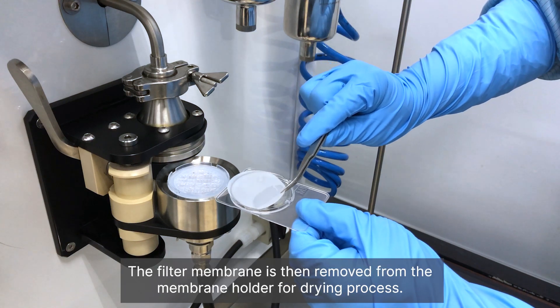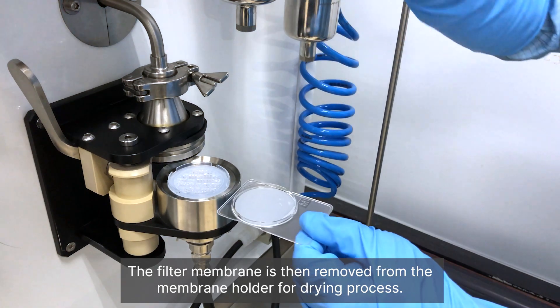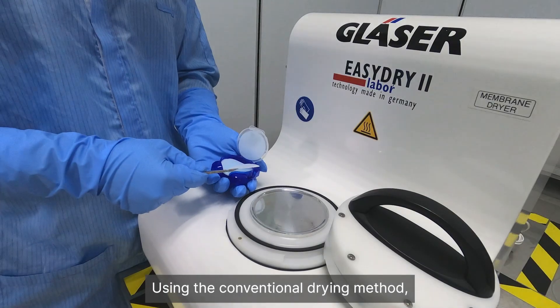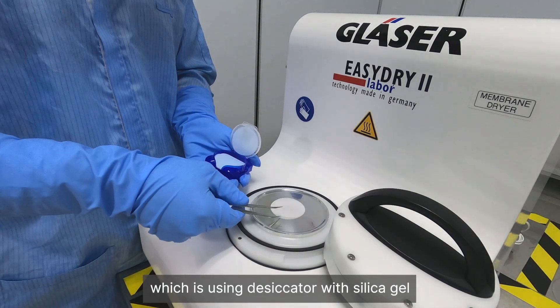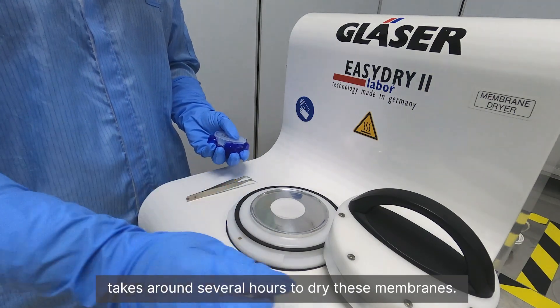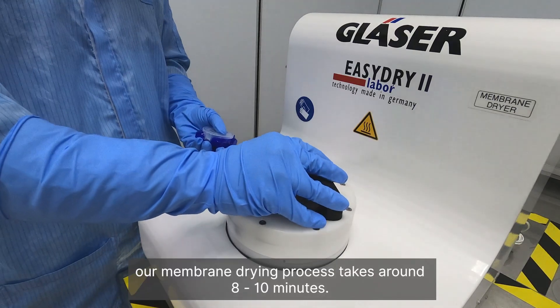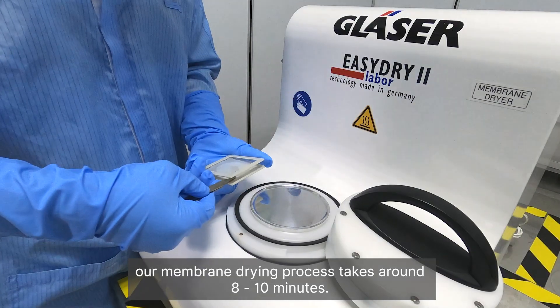The filter membrane is then removed from the membrane holder for the drying process. Using the conventional drying method — a desiccator with silica gel — takes around several hours to dry these membranes. With the easy dry membrane method, our membrane drying process takes around 8 to 10 minutes.